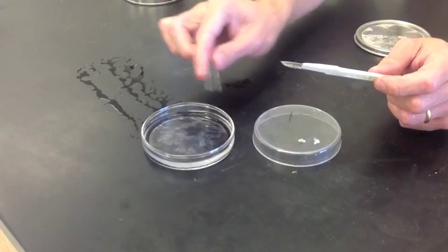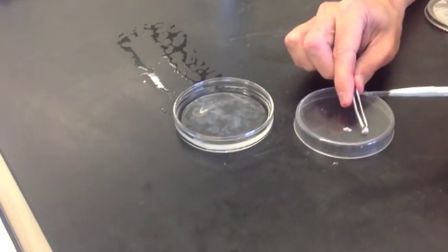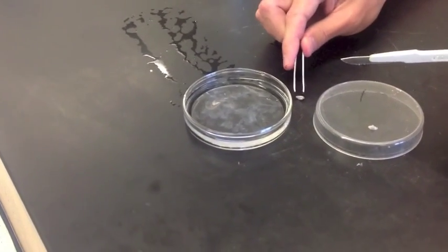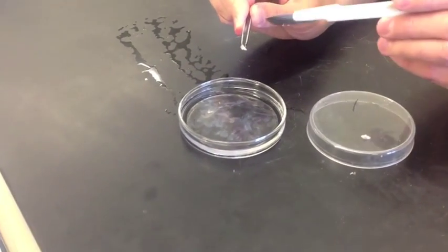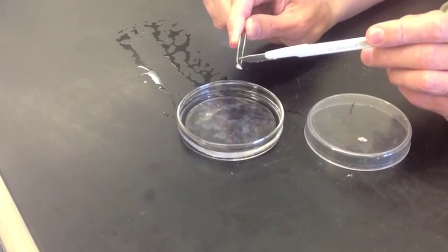So I'm going to ask my camera person just to kind of focus right here in this area. And we're going to take our piece of sodium. And if all goes well, we should see a reaction with the water. And the phenolphthalein should cause the water to turn pink because of a base being produced. Here we go.